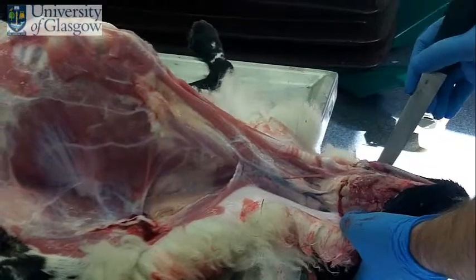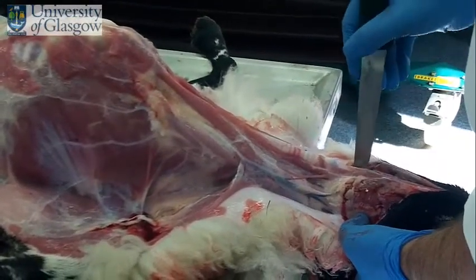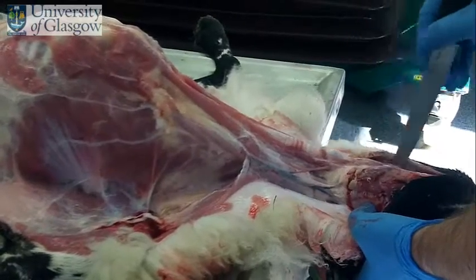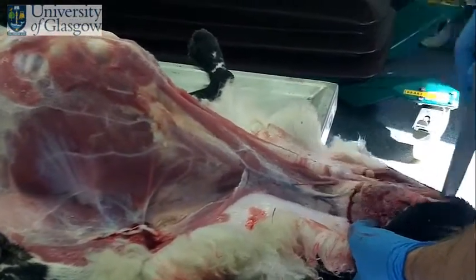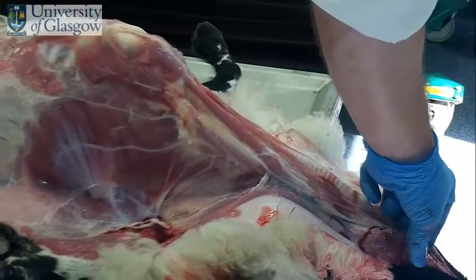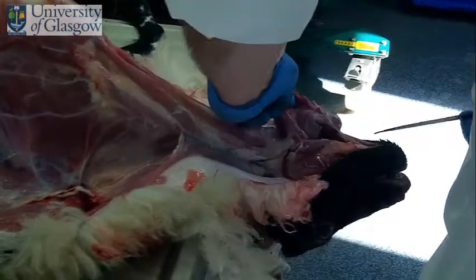Now that we've examined the nodes, what we're going to do now is take out the organs. I'm going to make a deep incision just at the level of these nodes here, just at the base of the mandible. Make a deep incision running along the mandible, do the same on the other side. Get a hold of this flesh, cut through the frenulum and take the tongue out.